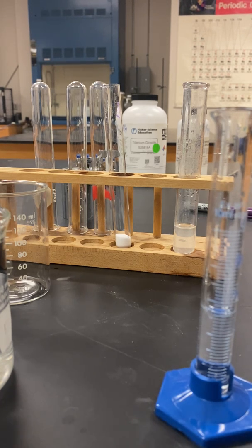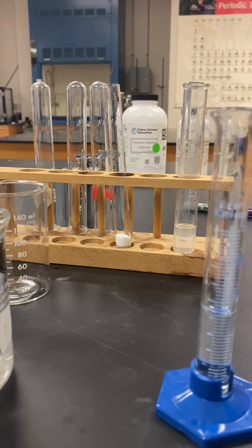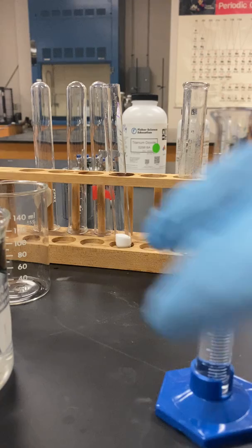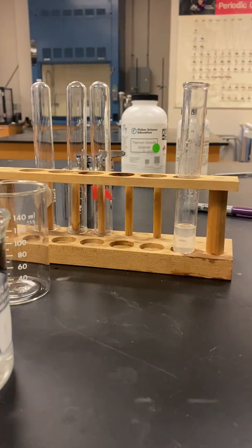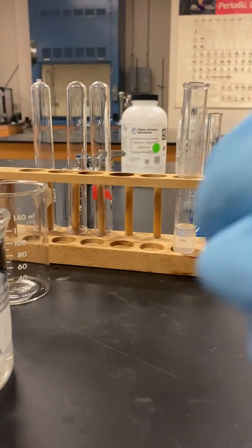So what we're going to do is place this 5 mL of room temperature water into this test tube and note the feel of how the test tube changes its temperature. So just pour that in there. And that is becoming extremely cold.